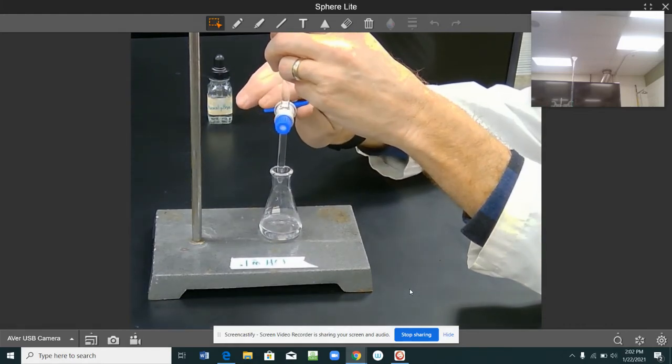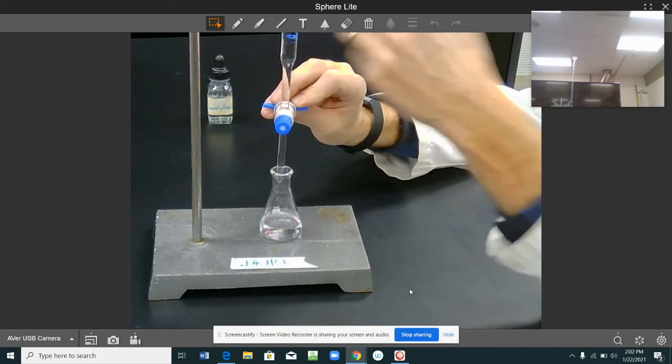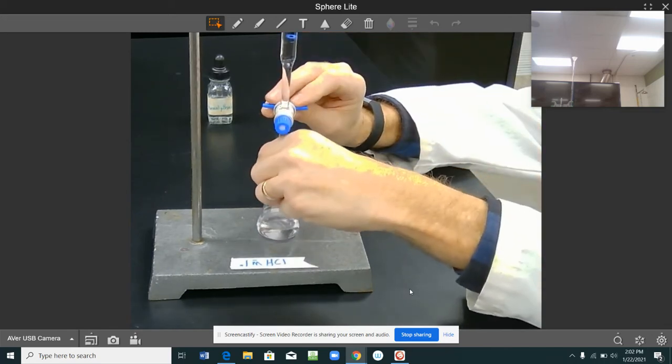What that means is I'm actually going to start letting liquid in. You guys can kind of see the stream. Now, do you see where the stream hits? Do you see what it's doing? See the pink color? What that means is the phenolphthalein is finding the base, and that's why it's changing color. Then it finds the acid, and that changes it back.